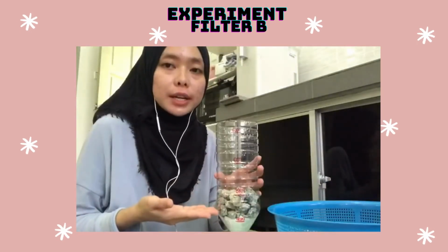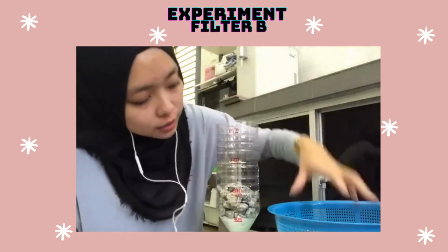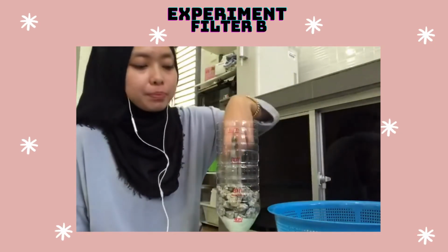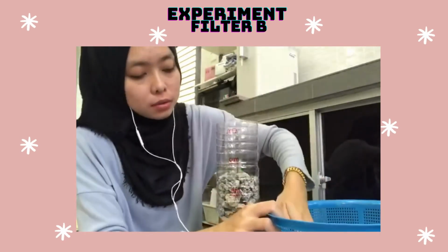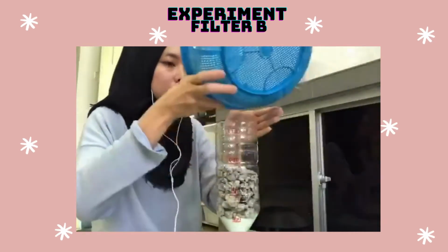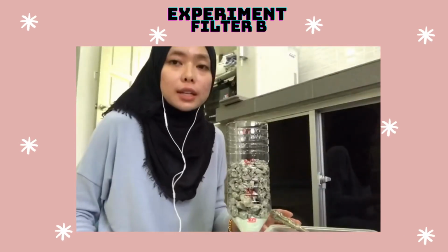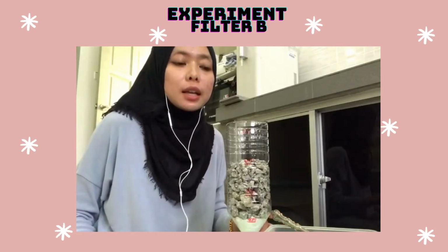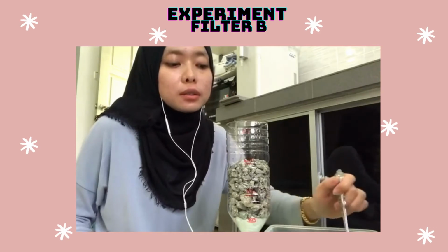Over the coarse aggregate, the fourth step, I put fine aggregate inside the bottle until 6 cm. Final step, I use sand as the final layer of 6 cm.